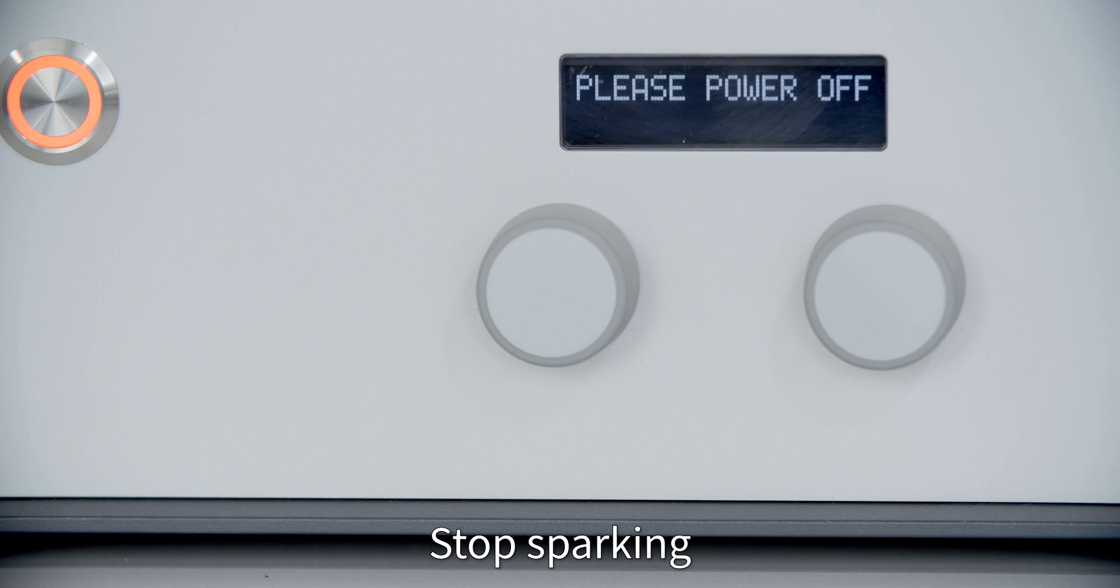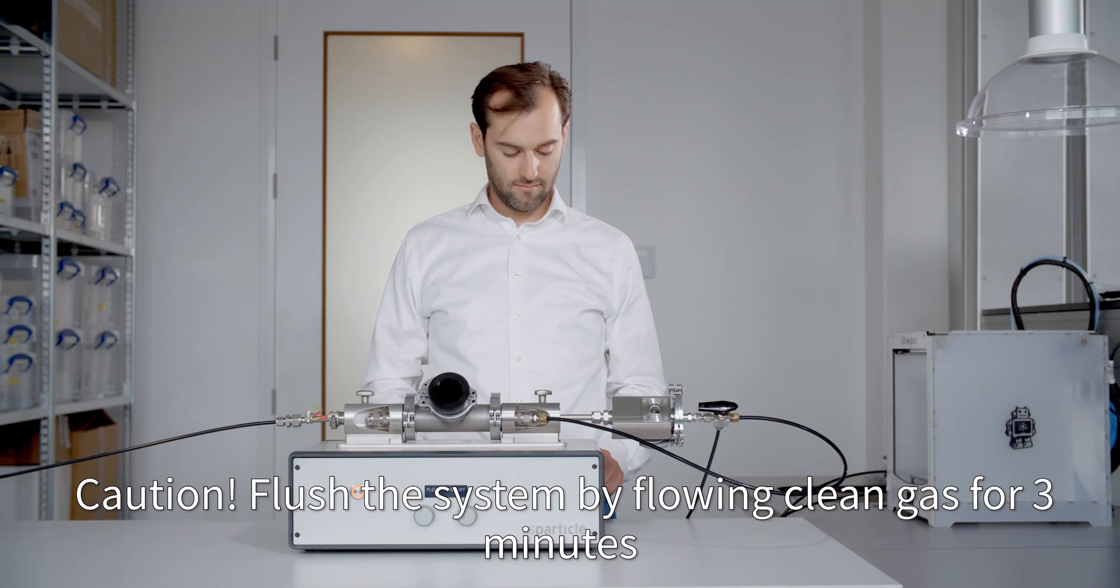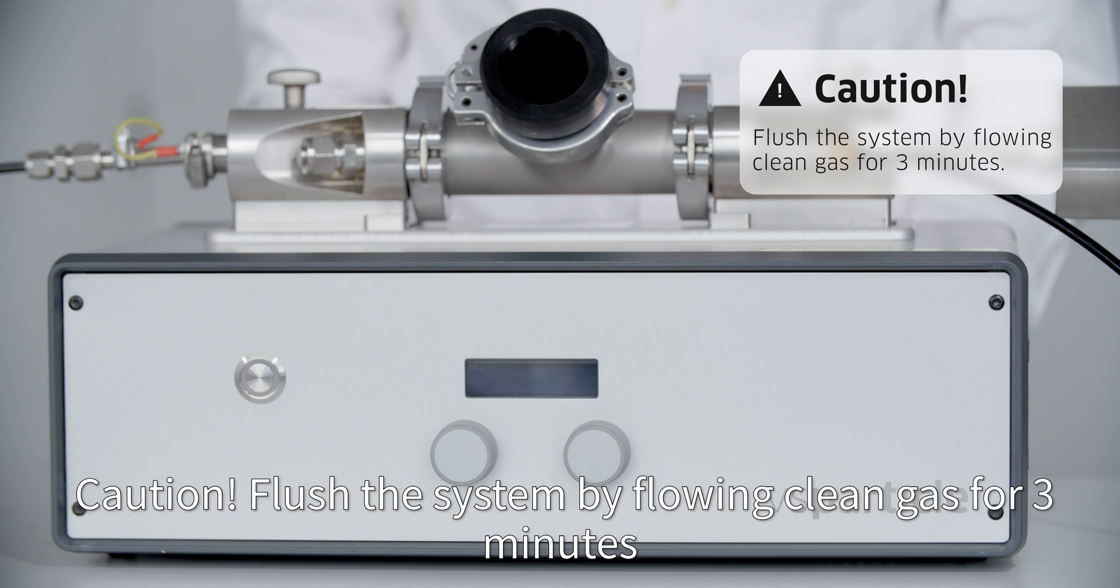Stop sparking. Caution! Flush the system by flowing clean gas for 3 minutes.